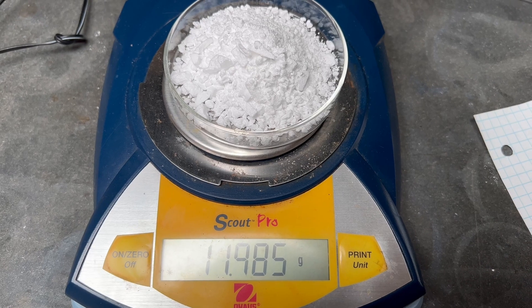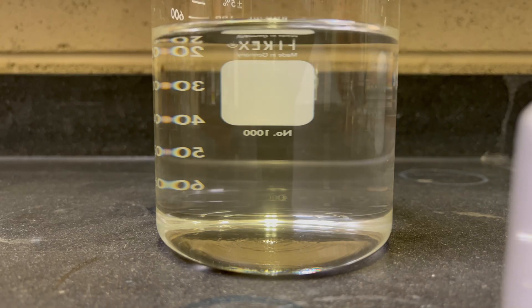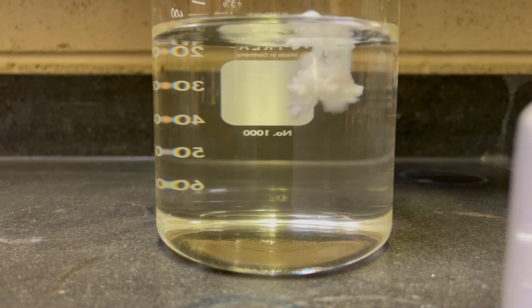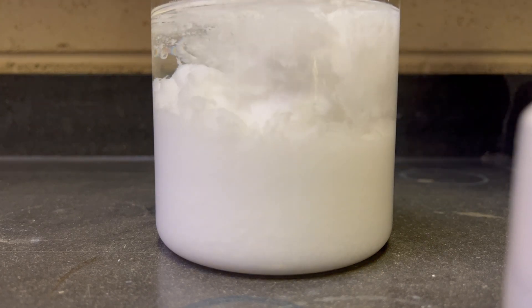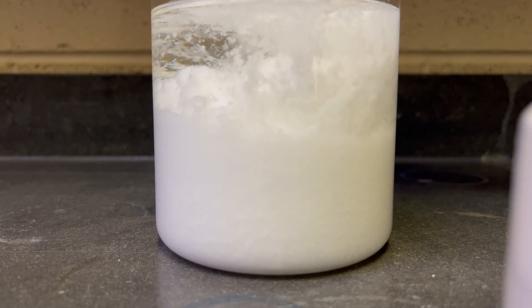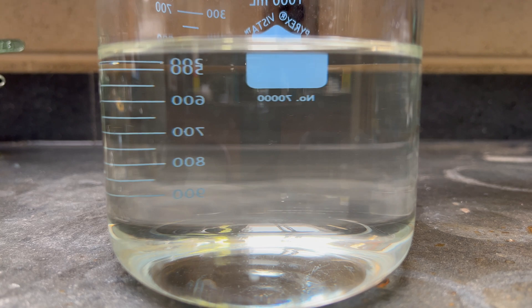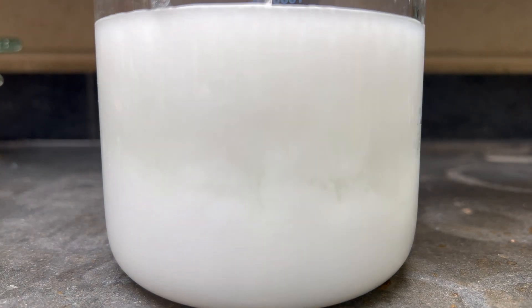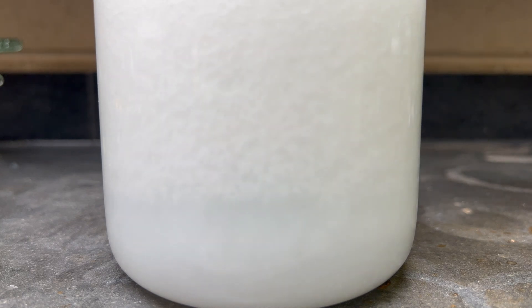The run yielded 11.9 grams of benzoic acid.